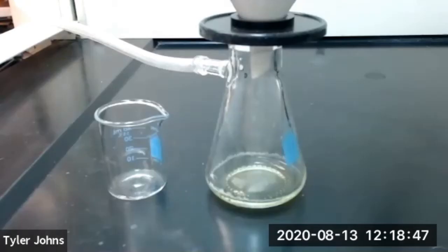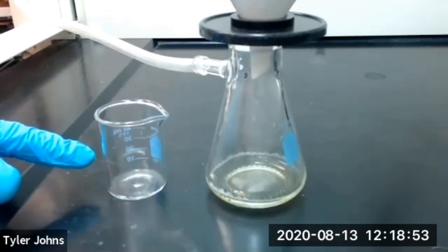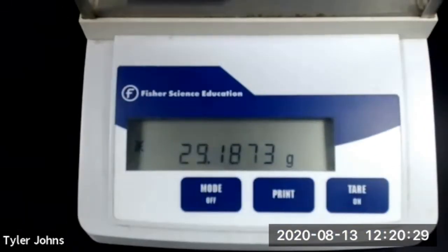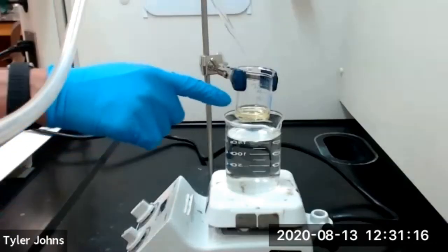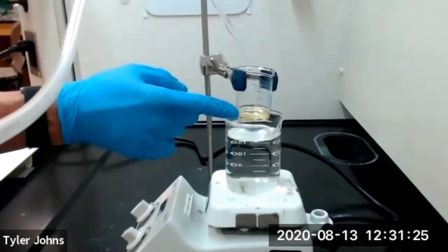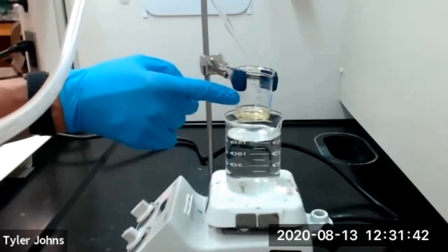For our optional exercise, we need to transfer the mother liquor from our filtration to a pre-weighed 50-milliliter beaker. The mass of our 50-milliliter beaker is 29.1873 grams. We've transferred our mother liquor to our pre-weighed 50-milliliter beaker, and we're going to lower it into a hot water bath to evaporate off the 95% ethanol. We'll also direct a stream of air into the beaker to speed up evaporation.